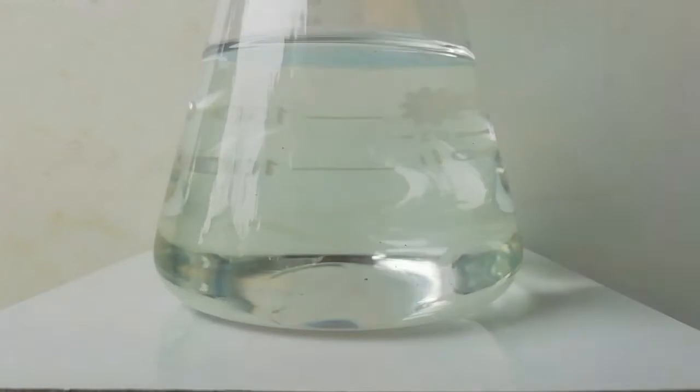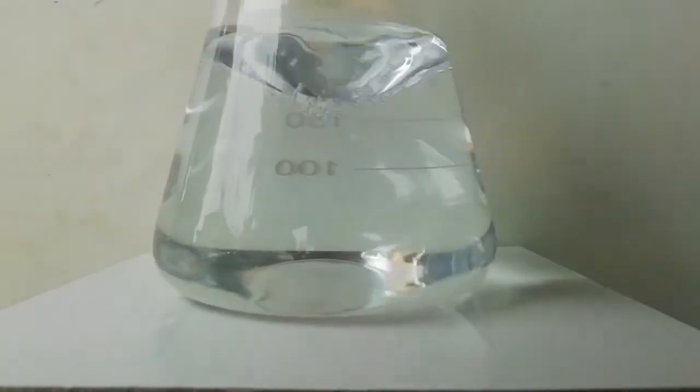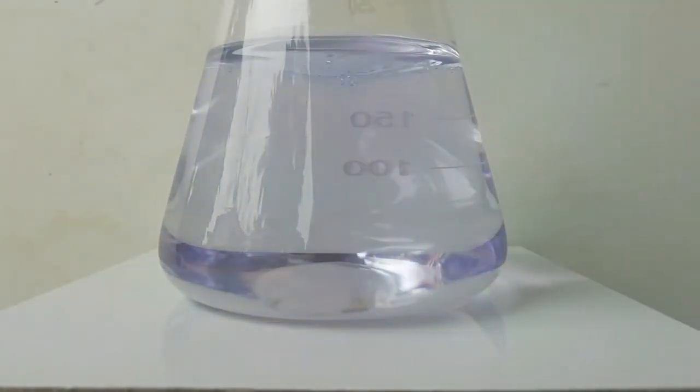Now the solution needs to be shaken. When the solution is shaking, it turns blue, and when kept to settle down, it turns back again to a colorless solution.